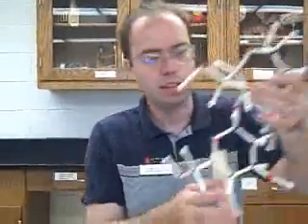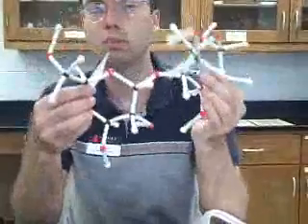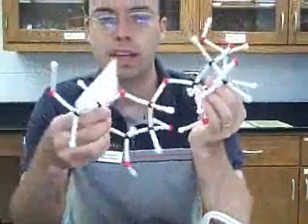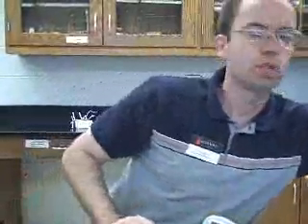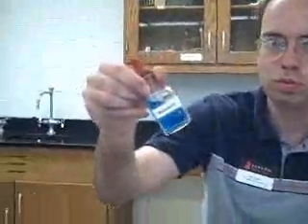Disaccharides are simple sugars with two sugar rings, like maltose. For simple sugars — monosaccharides and disaccharides — we use a Benedict's test, which is a royal blue chemical.